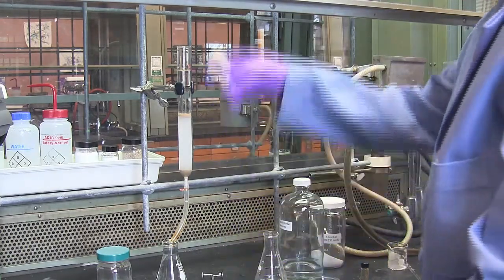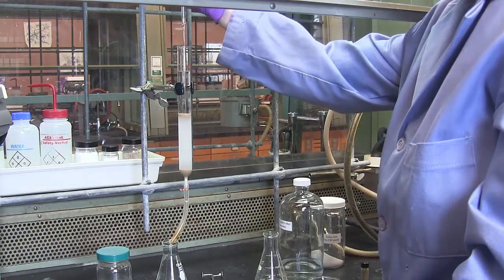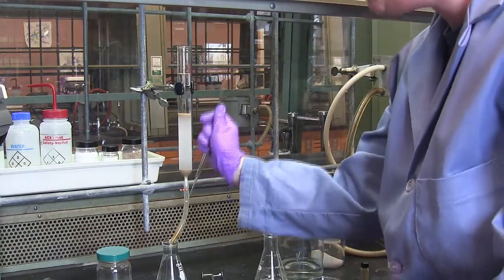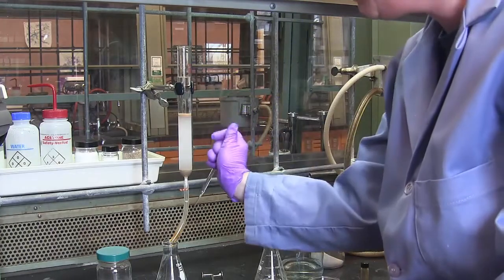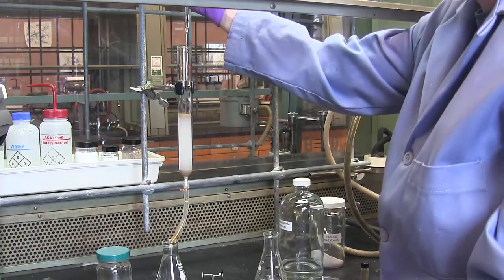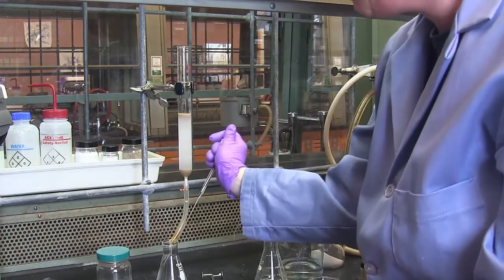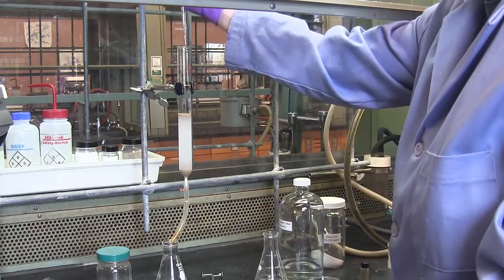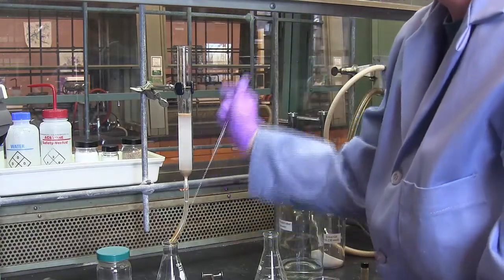At this point, we're actually ready to begin loading the sample onto the column. The problem is there's too much solvent on the top of the sample. If you have a pipette in which you can reach the solvent, it's perfectly acceptable to remove some of that solvent from the top of the column. I want the solvent to drop down to the level of the sand, but I don't ever want the silica gel to dry. I always want solvent to be on the silica gel as long as there is something on the column that I want to get off.